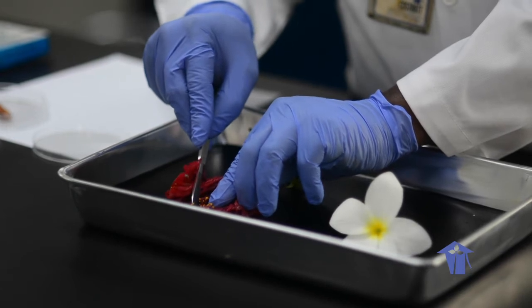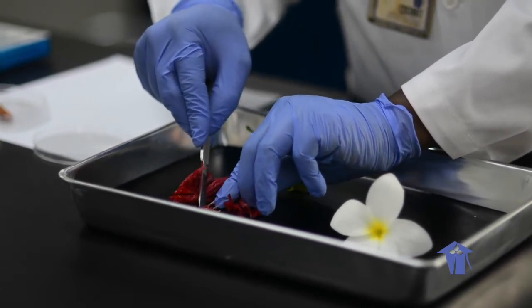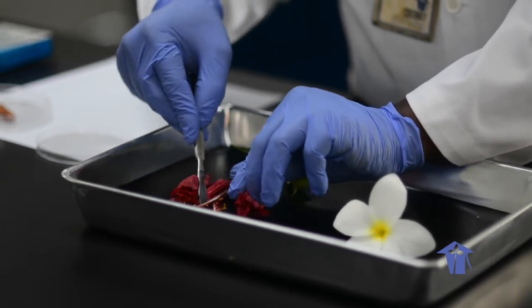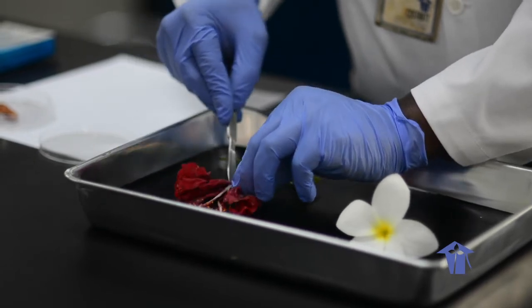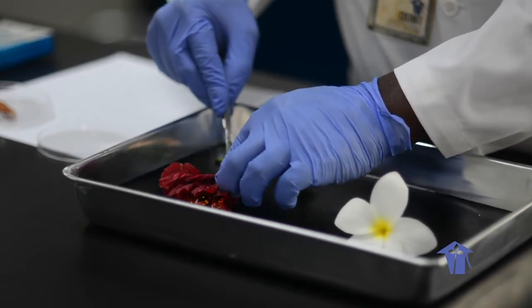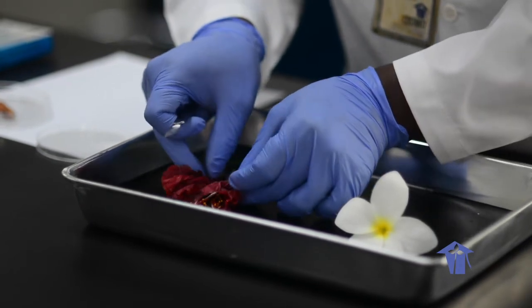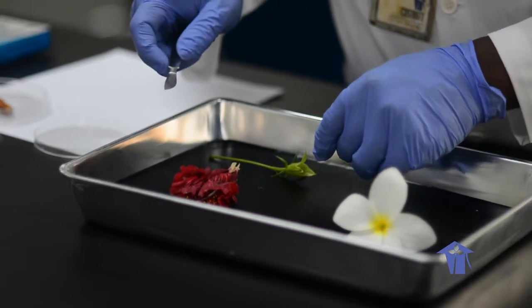And so on the outside here, you have the anther and filament, right? And up top you have the stigma, running on the inside, the style, and then down at the bottom you have the ovary, which we're not seeing. Well, let me see if I can get the ovary better. I'm not seeing it, and the petals are a bit squashed there. Sepal.